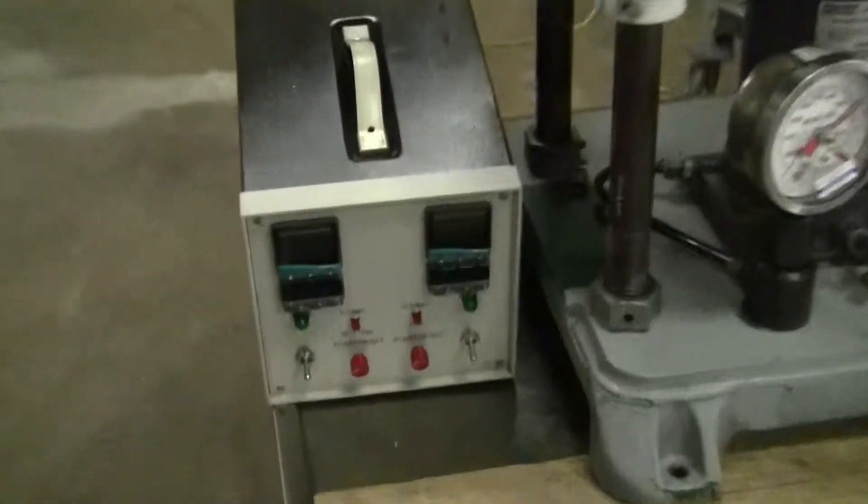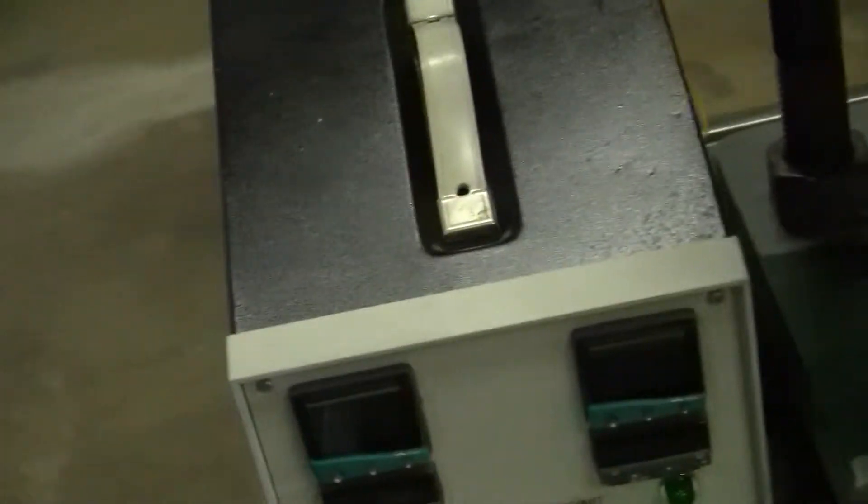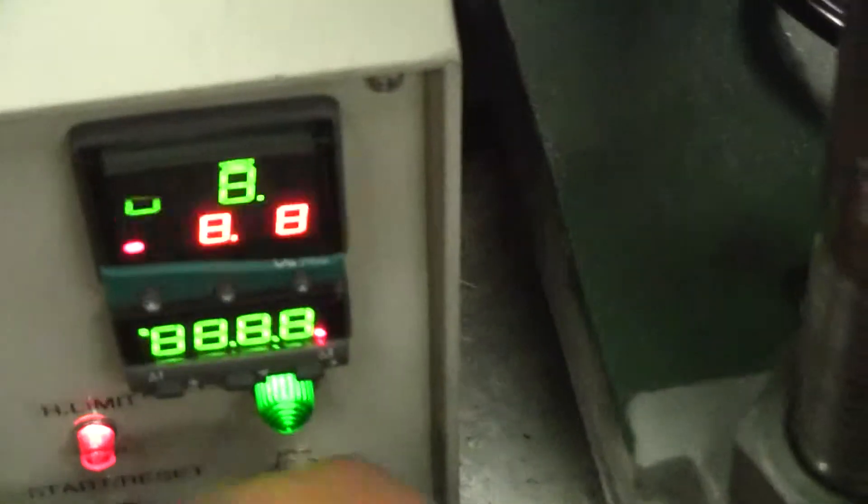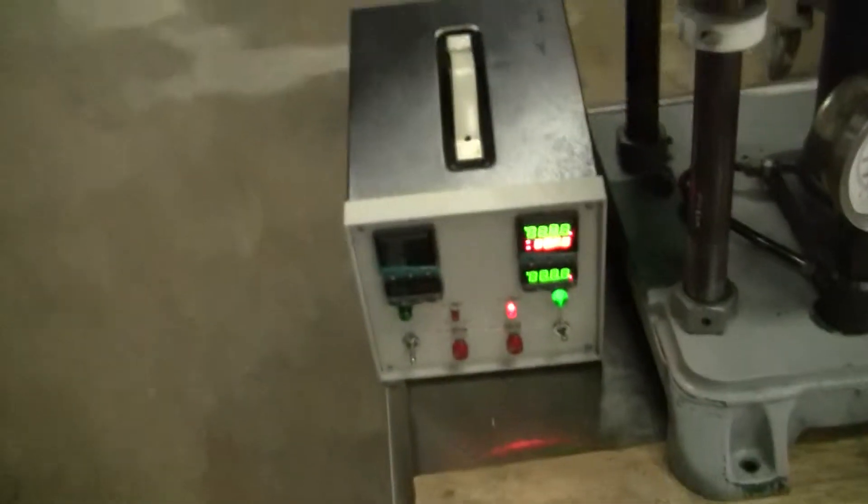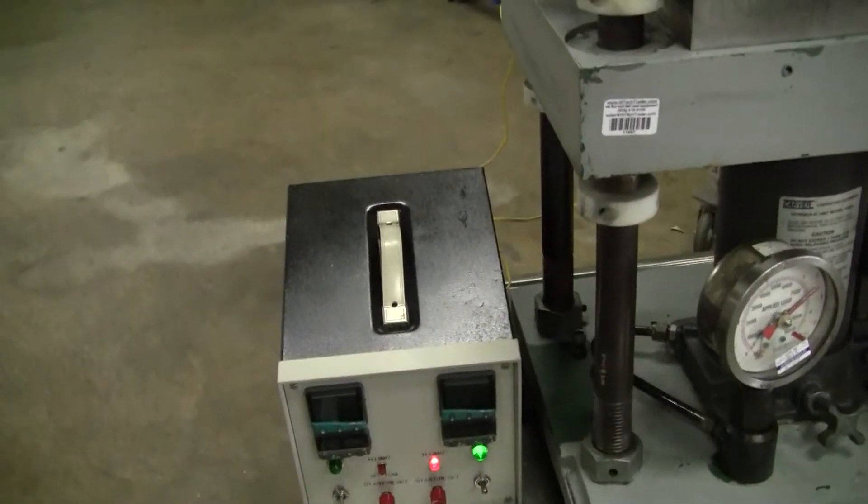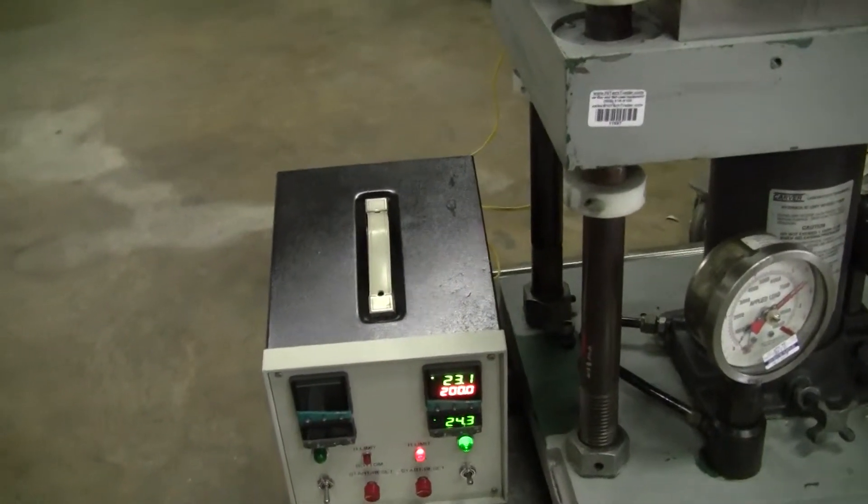And this is the controller. Again, I'm only going to demonstrate one side of it. So I'm going to turn this side on, one of the platens. What you want to do is let that come on, turn the green light on, and let it come up.